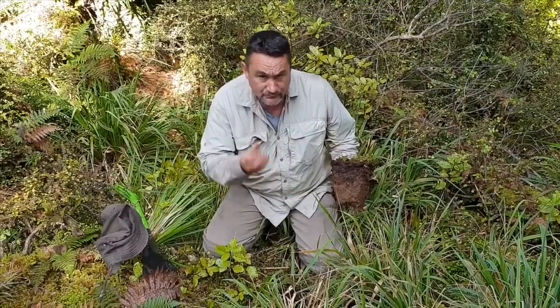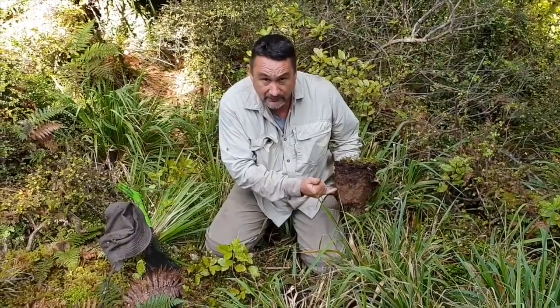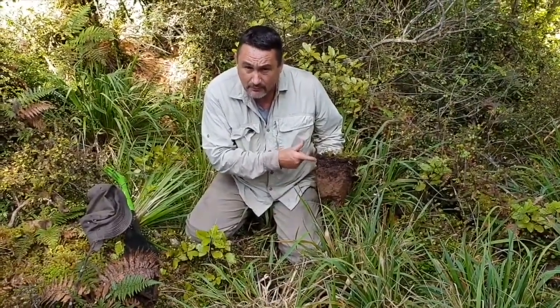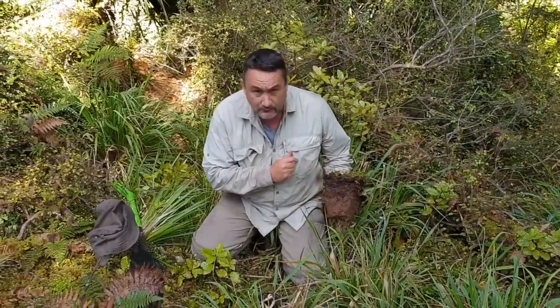We'll take some sub-samples here, specifically isolate the soil, preserve it, and take it back to the lab. We'll extract DNA — and believe it or not, we'll get DNA out of this soil. Wow. Belonging to the organisms in here — you've probably got about one billion microorganisms per gram of soil. That's one quarter of a teaspoon and over a billion microorganisms!